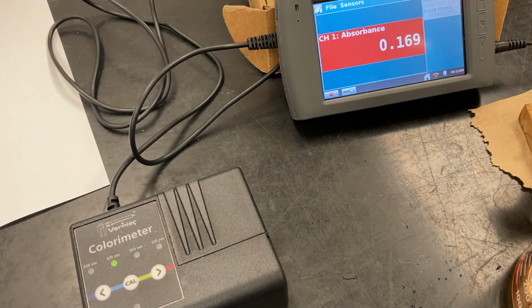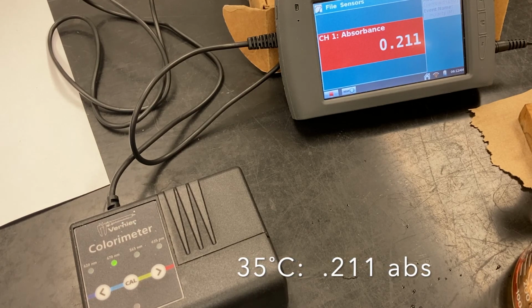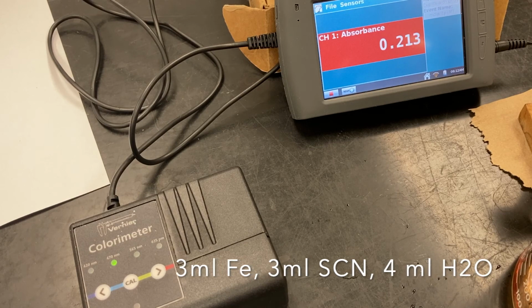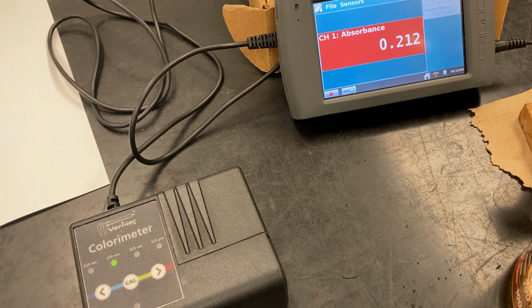All right, so the absorbance at 35 degrees, 0.211. Now, the proportions of solutions for part 4 were 3 milliliters of the iron, 3 milliliters of the thiocyanate, 4 milliliters of water. And this was the same concentrations that we used in part 3, so 0.002 molar.